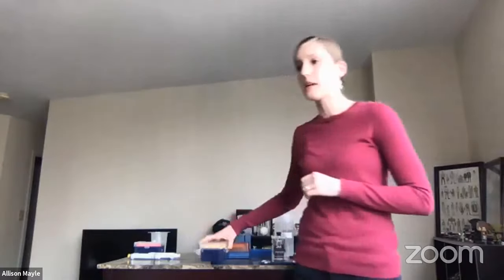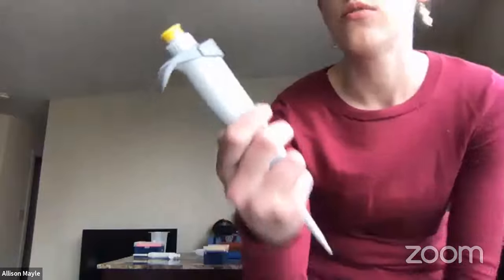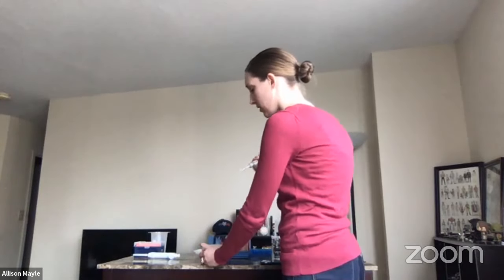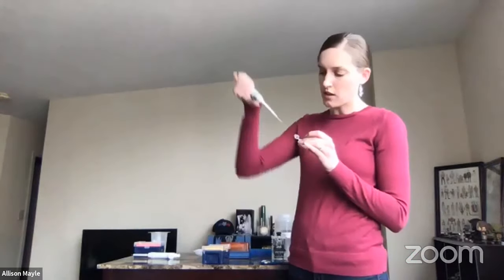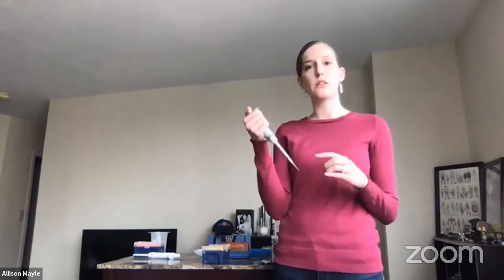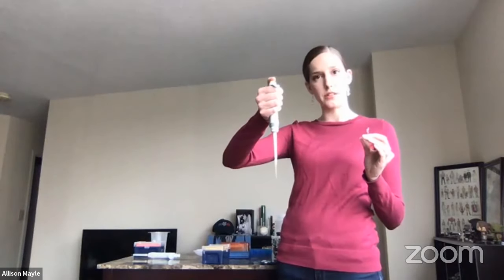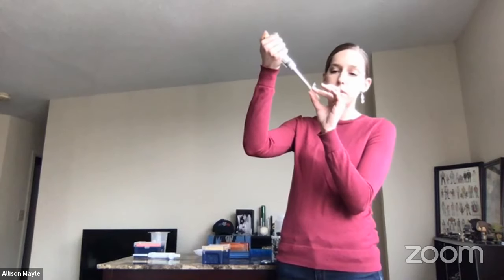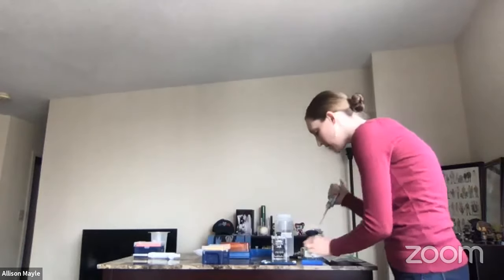Now I'm going to use my micropipette to transfer 23 microliters of primer mix into the bead. I have my pipette set to 23.0 microliters — the line stands for the decimal point. I'm going to get a fresh pipette tip so I don't have any contamination. Into my tube for my plant, I'm going to put my RBCL primer mix. I'm going to press down to the first step, releasing 23 microliters of air out of the pipette — just like an eyedropper. I'm going to put the pipette tip into my primer mix, release my thumb, and that draws up 23 microliters of RBCL primer, and I'm going to add that to my bead.